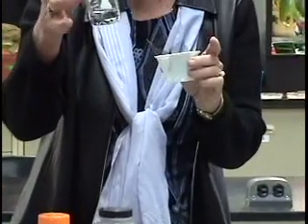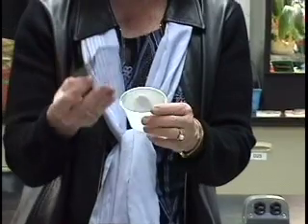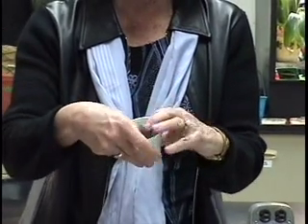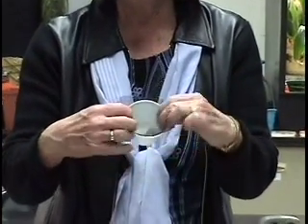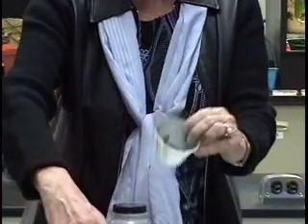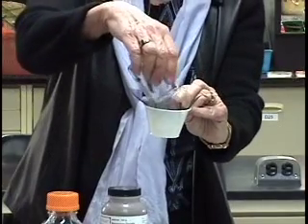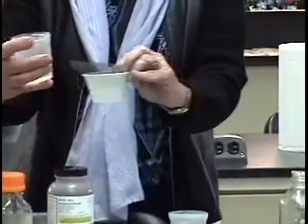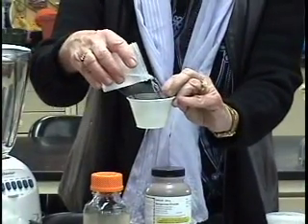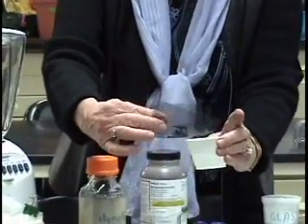Okay, so after the students have made some shapes, cylinders and spheres, in order to handle them and measure them, you will need to take a piece of screen, and it could be something as simple as plastic screen that you can get at any hardware store, and put it in another beaker or a plastic cup, and you pour the solution through the screen, and then simply take some tap water and rinse the structures with tap water, and then they're ready to be measured.